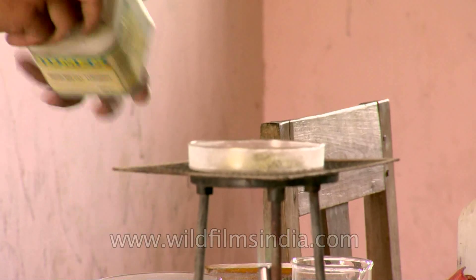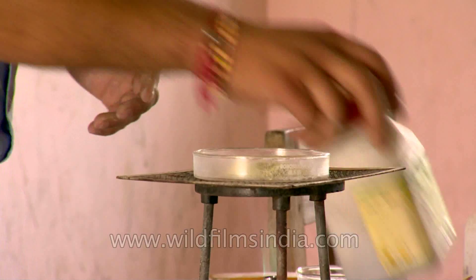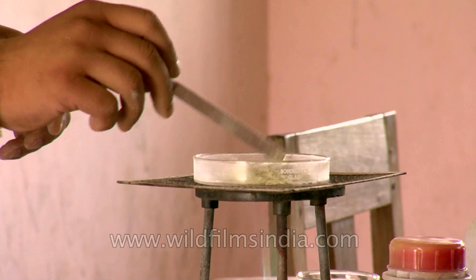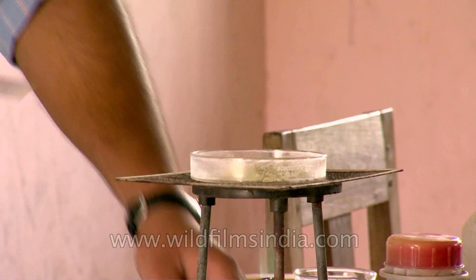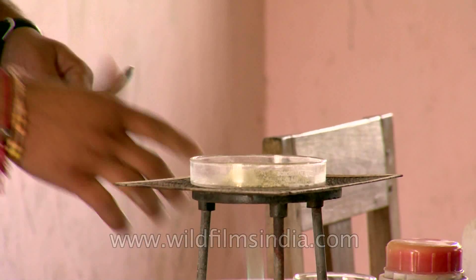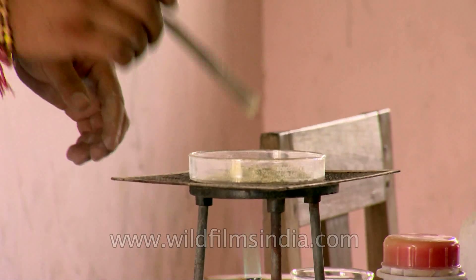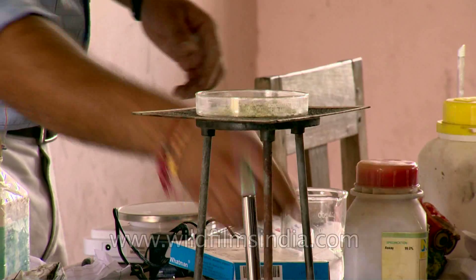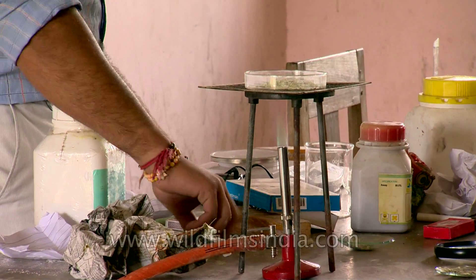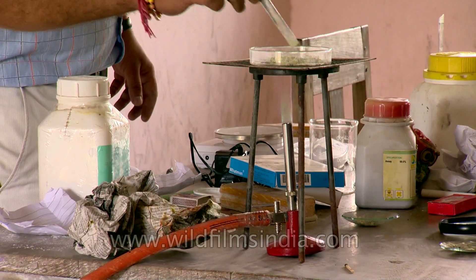After forming the compound, we will be studying the properties of the compound with all three aspects. Now, while the mixture goes on for its preparation, we will go to another experiment.